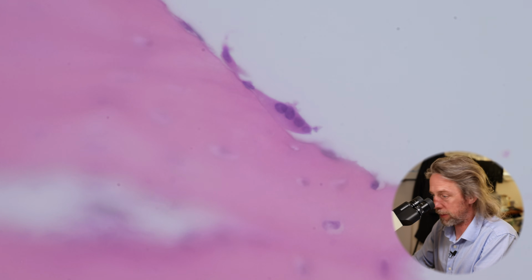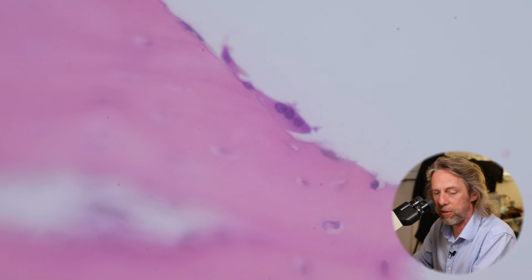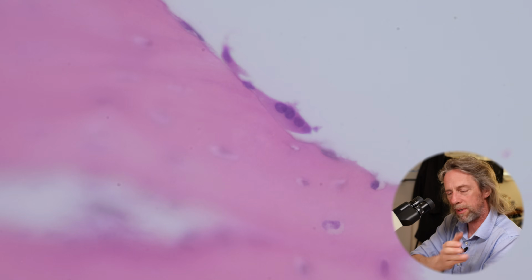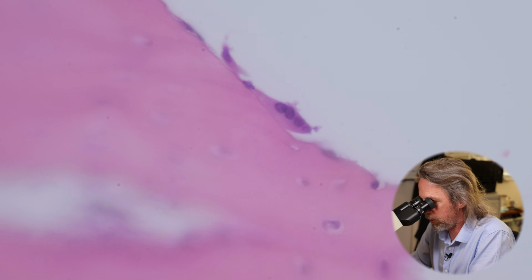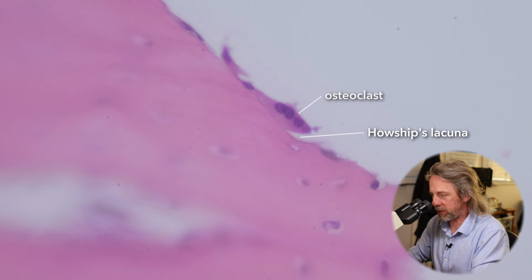Look at that one there. That is 4 nuclei smushed together, and they're living within the same cell membrane, right? There's no division between those cells. That's another osteoclast. And you can just see the scoop taken out of the surface where it is eroding the bone. So that's a lacuna. That lacuna it's digging for itself is called a Howship's lacuna. I think people still use that term.